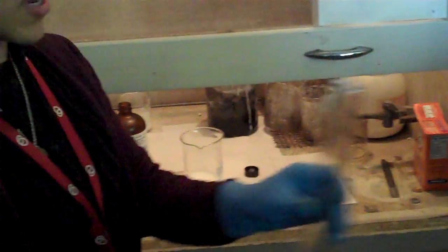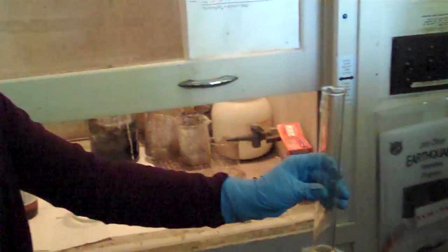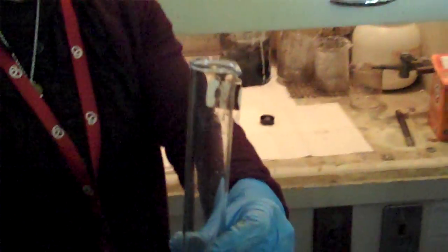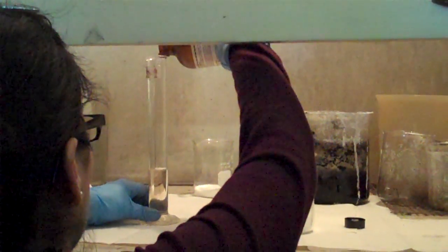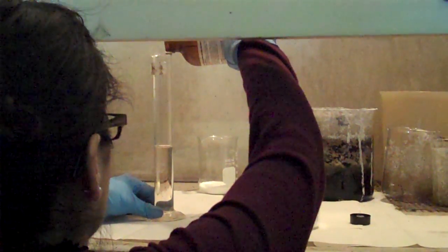This is really dangerous stuff and actually I did the demo yesterday and if you can look at the back of the little label, that's some of the sulfuric acid that kind of got spilled out. So I don't want any of this stuff on me. This is why I'm wearing gloves and you don't want any of this stuff on you either. I'm going to put a little drop on my finger. Ah, not a good idea. It would eat through your skin. Yes it would. So don't touch anything that's in the fume hood. Will it go through the gloves? No, I don't think it'll go through the gloves. I hope it won't go through my gloves. The gloves will turn yellow though.